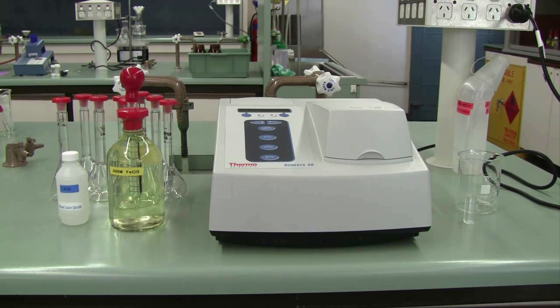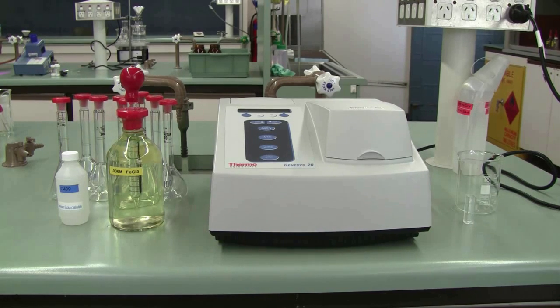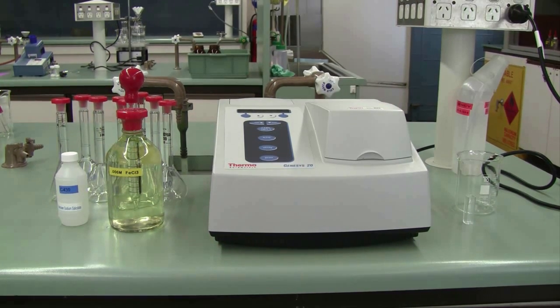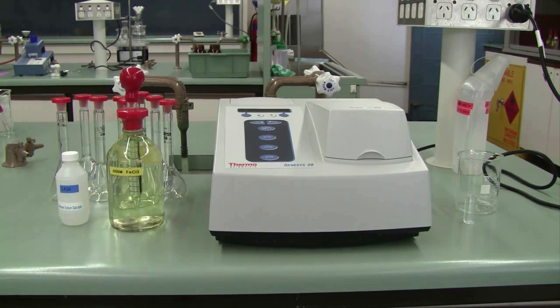In today's experiment we'll be using UV-visible spectroscopy to determine the concentration of sodium salicylate in an unknown sample provided to you. The experiment will also provide excellent practice when using analytical instrumentation, so you can refine your technique using pipettes, burettes, and standard flasks.